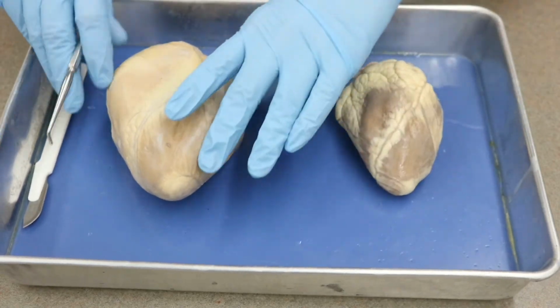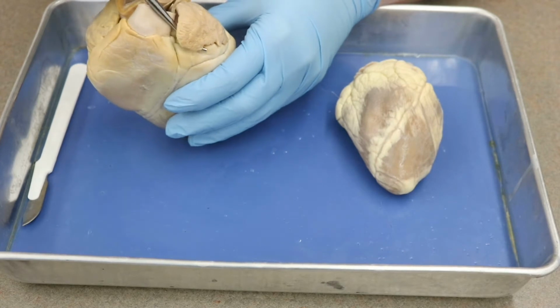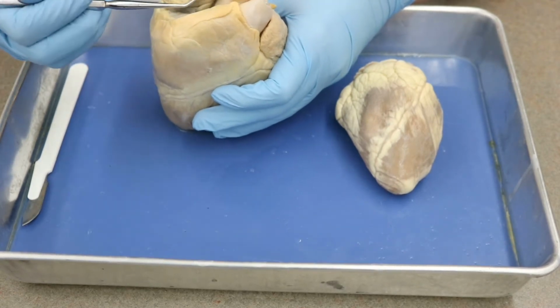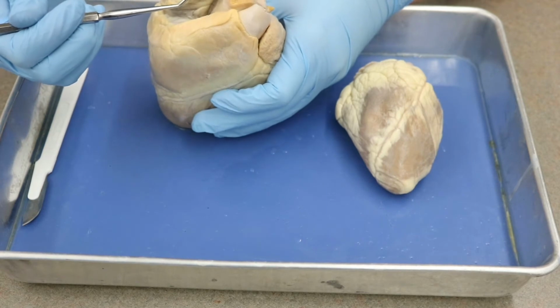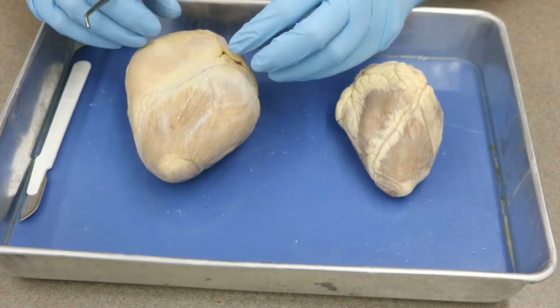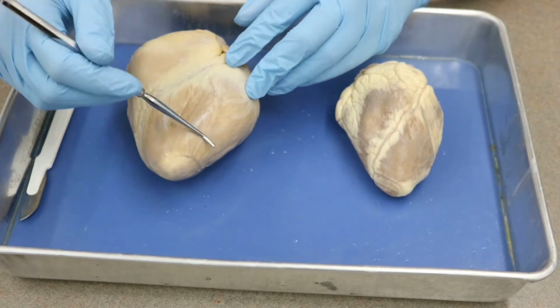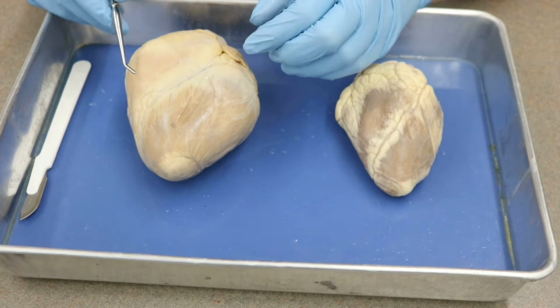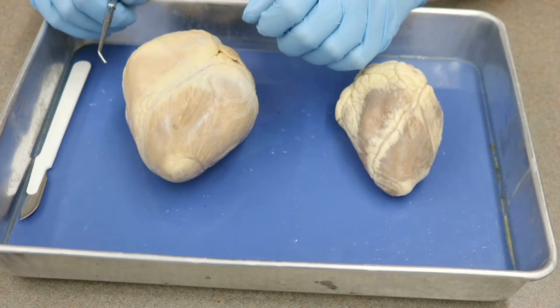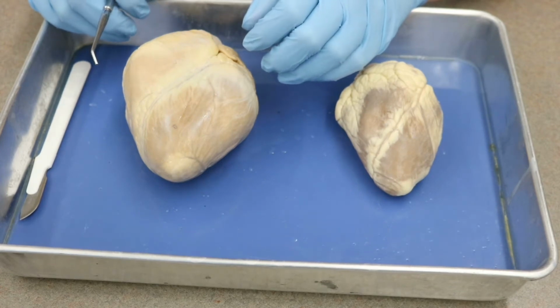Okay, same thing on the pig heart. So we have our left auricle here, and our right auricle is here. So we know that in both cases the atria are attached to that particular area, and then of course the ventricles will be below that. All right, so with that understanding, we'll go ahead and move on, and let's see what's on your lab sheets.